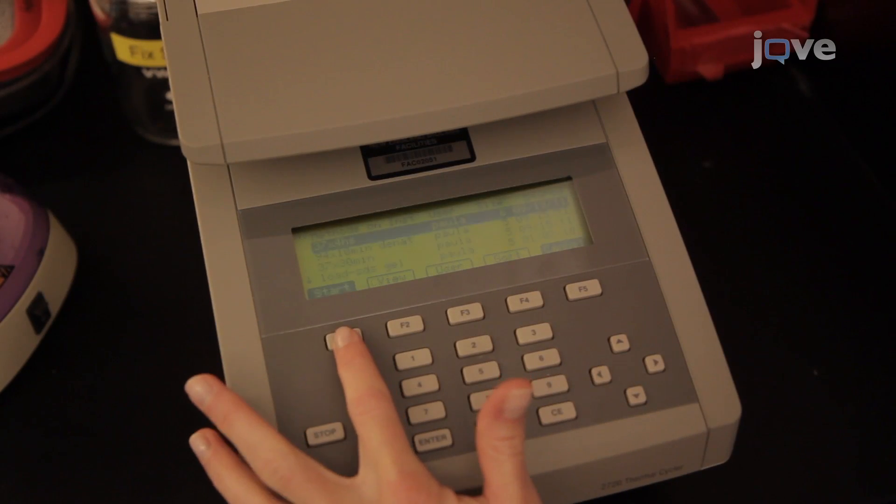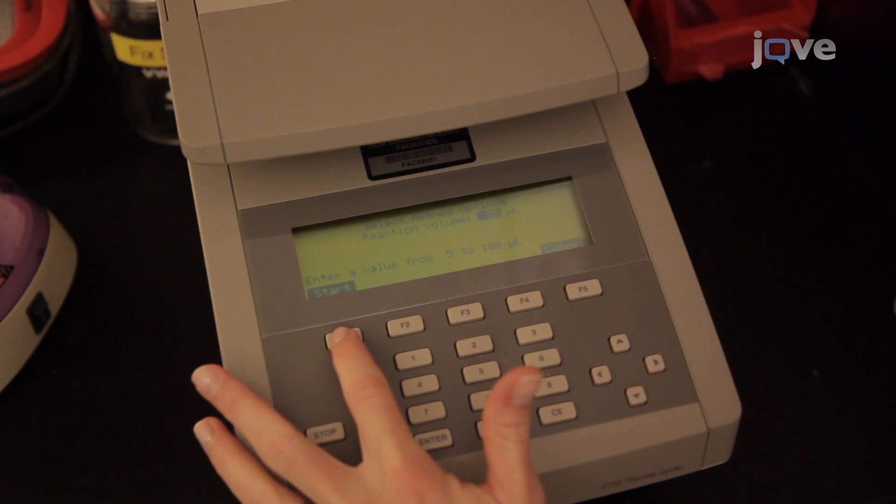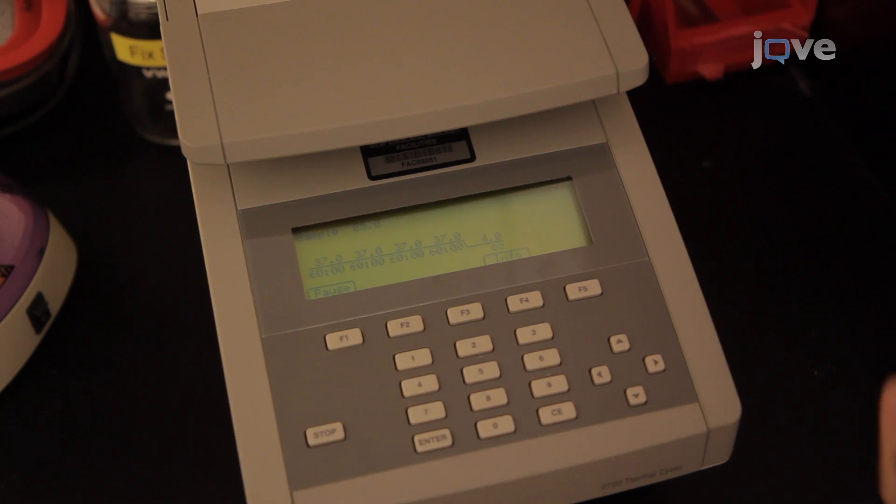Incubate at 37 degrees Celsius for 4 hours, followed by cooling the samples to 4 degrees Celsius.